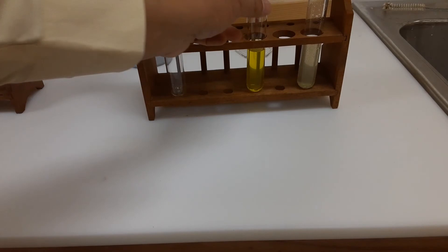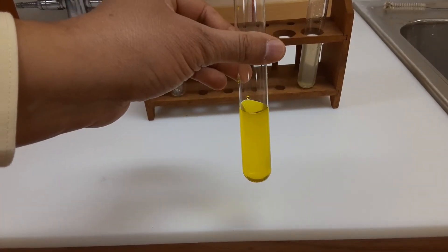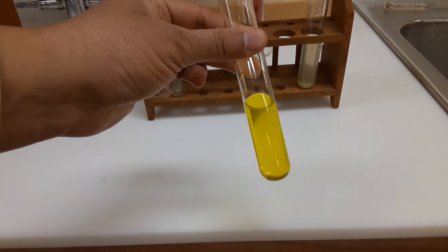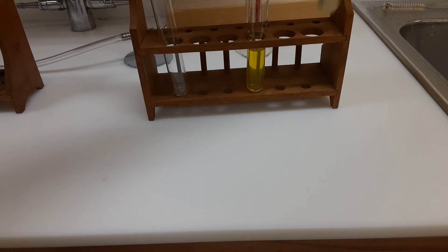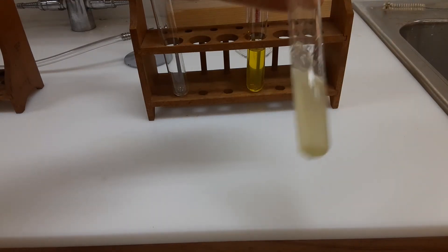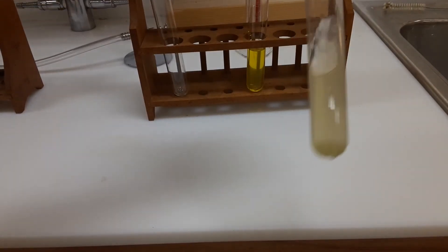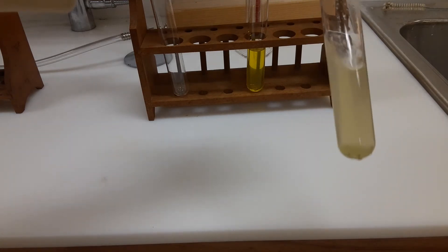Here we have a test tube with potassium chromate in it. As you can see, potassium chromate is a yellowish clear liquid. The other test tube contains a solution of iron sulfate, which has a light green color. So we have one solution with potassium chromate and another with iron sulfate.